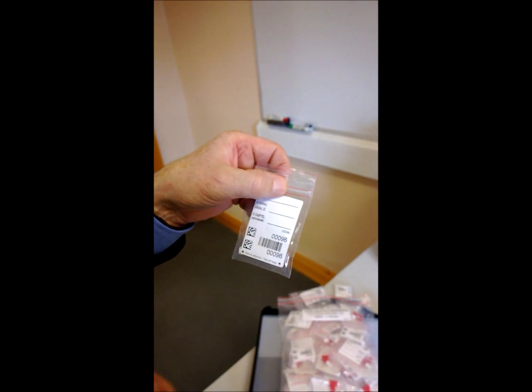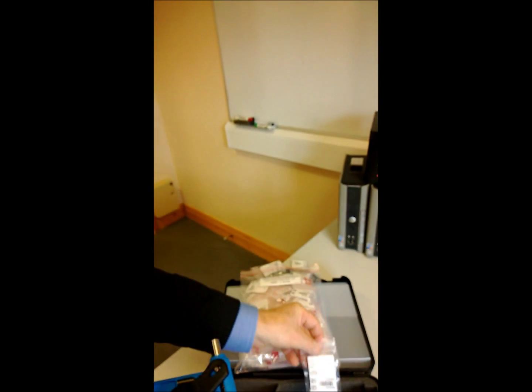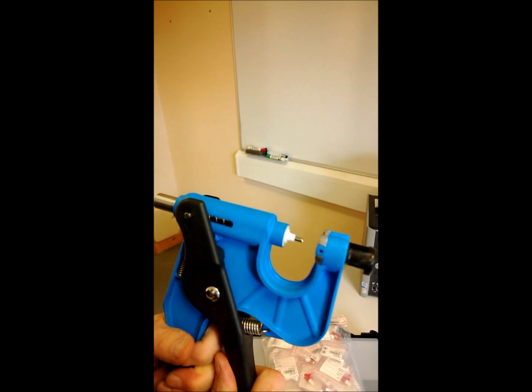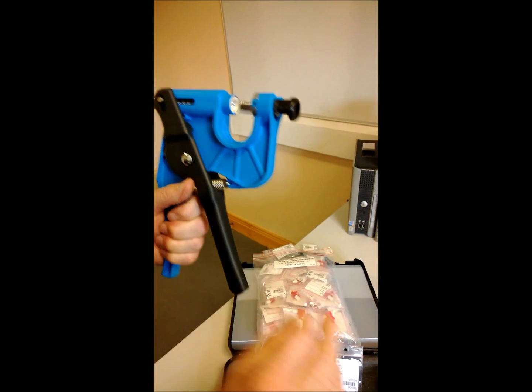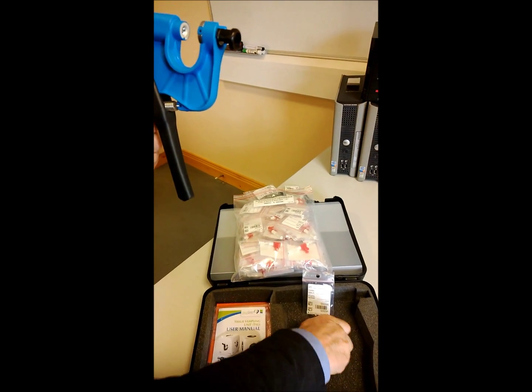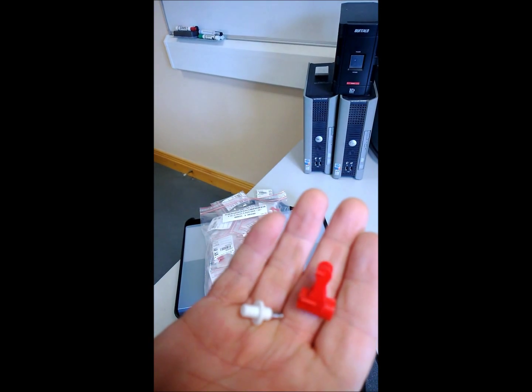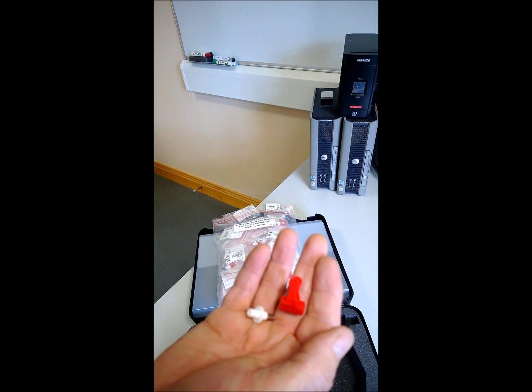The gun has a little white piece - simply open the two handles outwards and both of those pieces are waste and are not needed anymore. You now have your sampler ready to go to the laboratory and can proceed to do the next animal.